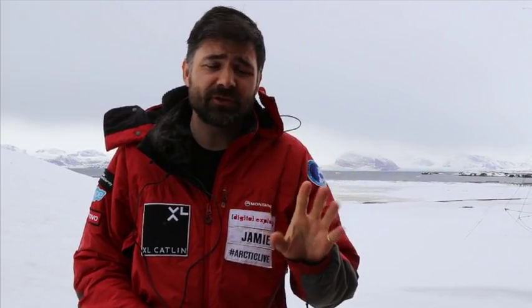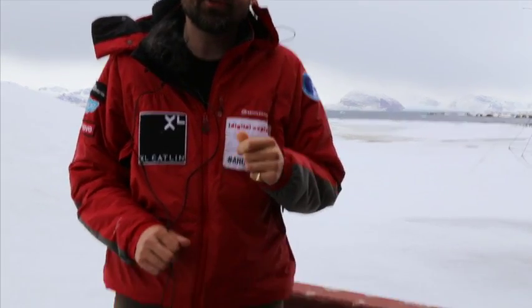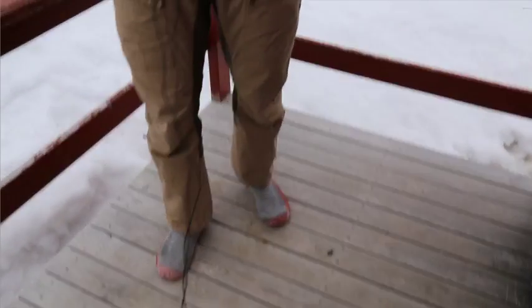There's also the need to be very, very careful. I talked about rinsing, not contamination, not doing the sort of cross-contamination thing of wiping your hands on your trousers. That definitely wouldn't be terribly professional. So a lot of care is taken to make sure that the samples we do take are an accurate representation of the waters here. I'm beginning to lose sensation in my toes, so just don't focus on my toes.